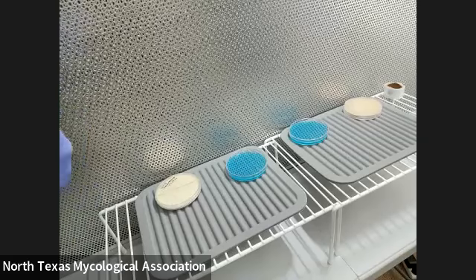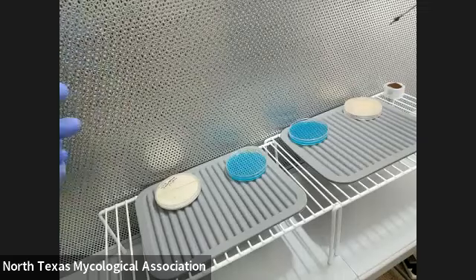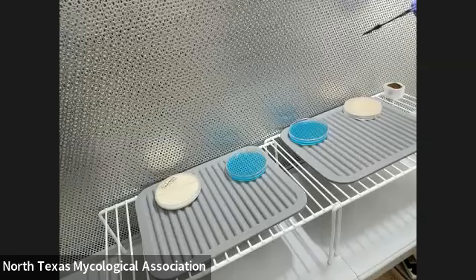Will you have enough scalpels for the class? I'm going to have two, just because we're only going to have two still air boxes. So people will take turns. If we can have like 20 air boxes there... I'm just going to let it cool for maybe 10 to 20 seconds. It cools faster in front of the hood because the wind blows on it.